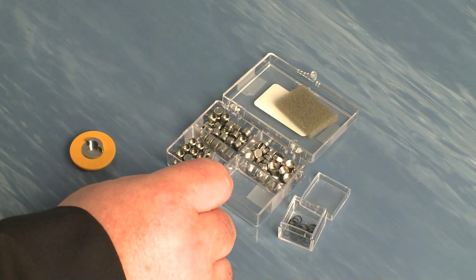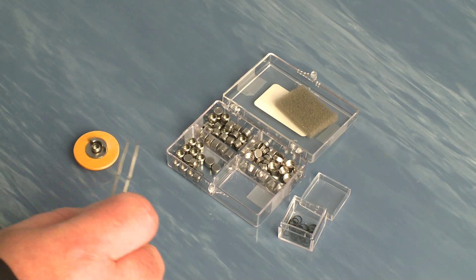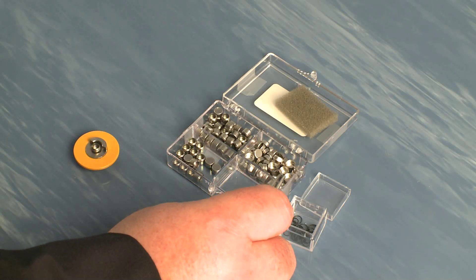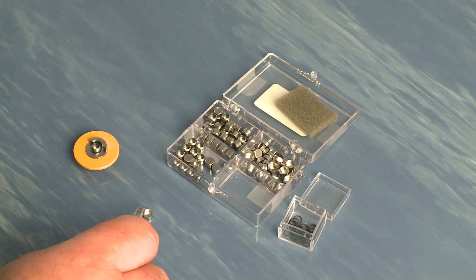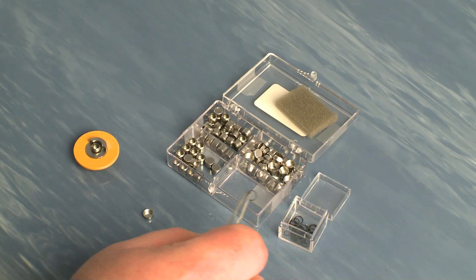Your sample is loaded into the pan and then put on the bottom die. The Viton ring goes into the top of the pan. Just use your forceps to kind of tamp it down.